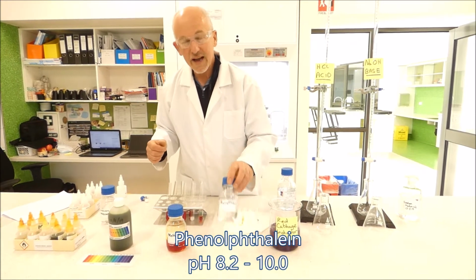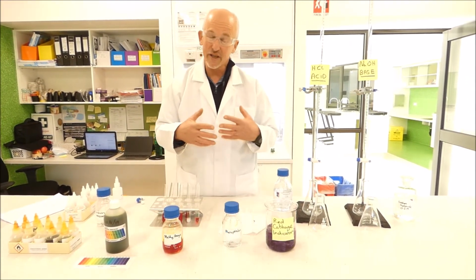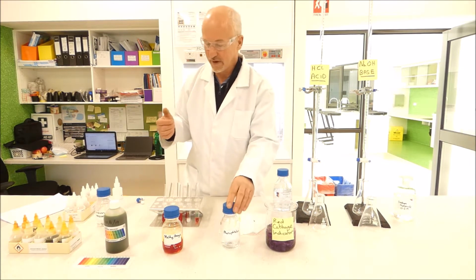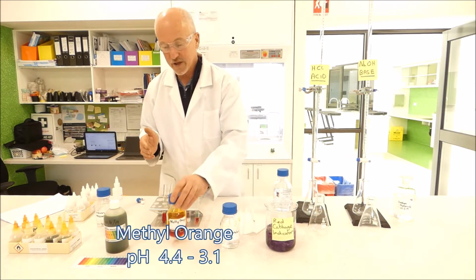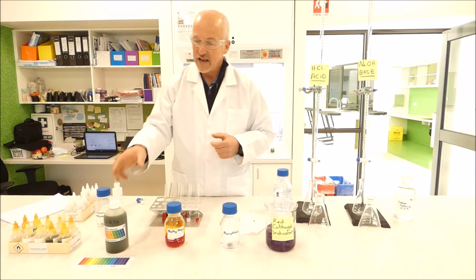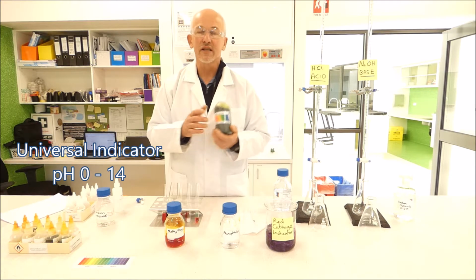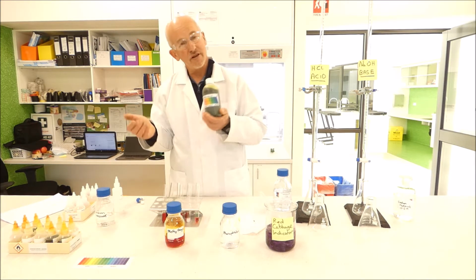We've got phenolphthalein, which is a base indicator, so it indicates when a solution gets to a certain level of alkalinity or becomes a base. We have methyl orange, which is an acid indicator, which tells you when a solution is getting towards an acid solution. And then we've got universal indicator, which can give you an indication of all the different pHs from very acid to very basic.